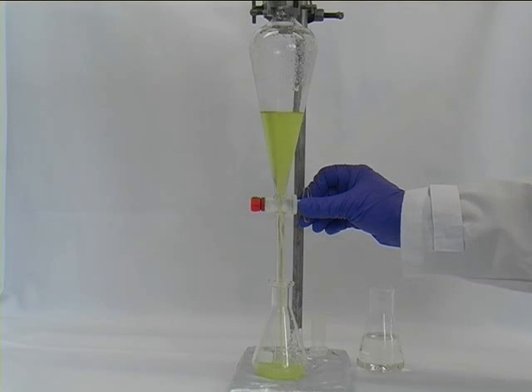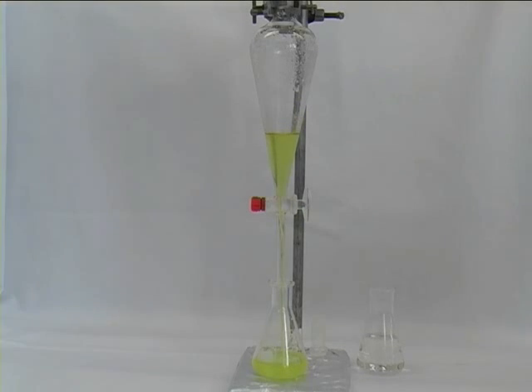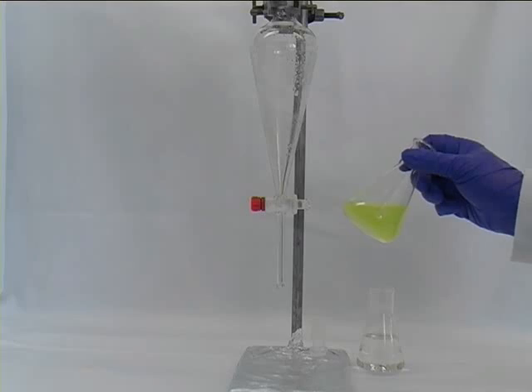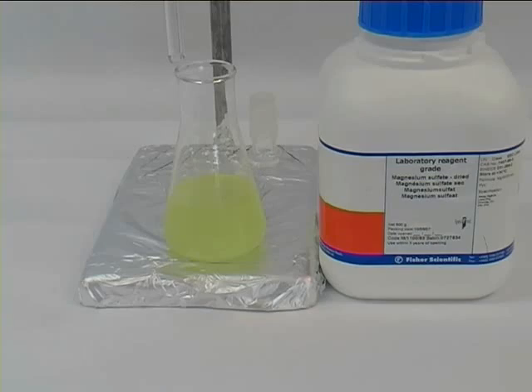So after you have separated the phases you will ultimately collect the organic phase that contains your desired solutes in a conical flask, and all that remains now is to remove residual water.